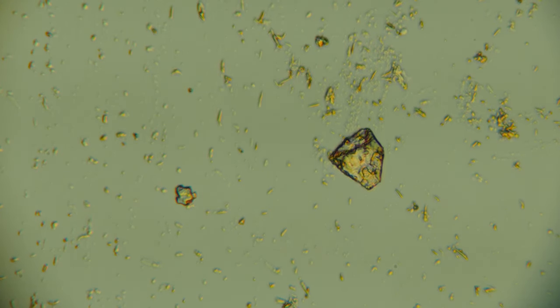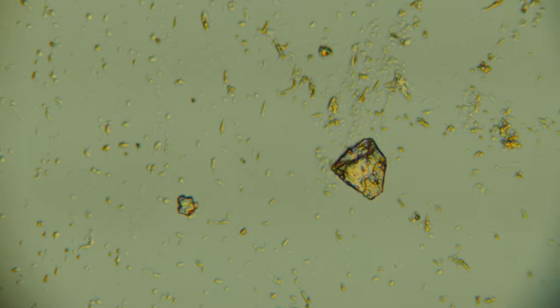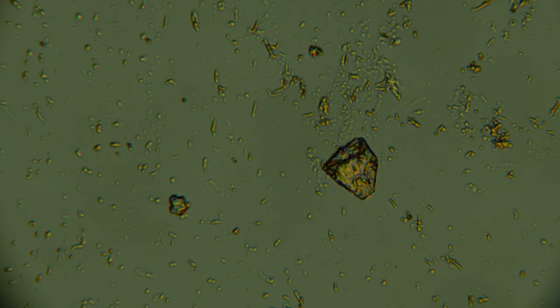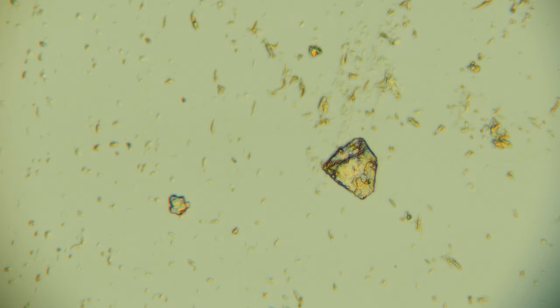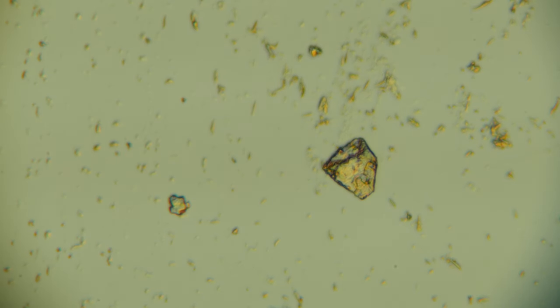Yeah, here we are without the projection eyepiece. I think I was having some problem with my condenser being a little bit too close, which makes it look a little bit like that. But with the condenser reasonably open, here's the 40x. I mean, we're seeing detail. So something tells me that maybe that projection eyepiece is causing the problem. Again, let's just compare it.